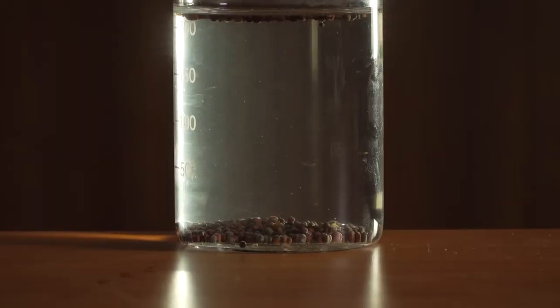Now let us see the seeds which have sunk to the bottom of the beaker. These seeds are solid, so they are heavy and they settle down. Farmers should use the seeds which settled in the beaker; those which are floating should not be used. This is the process of testing healthy seeds from unhealthy seeds in a given sample.